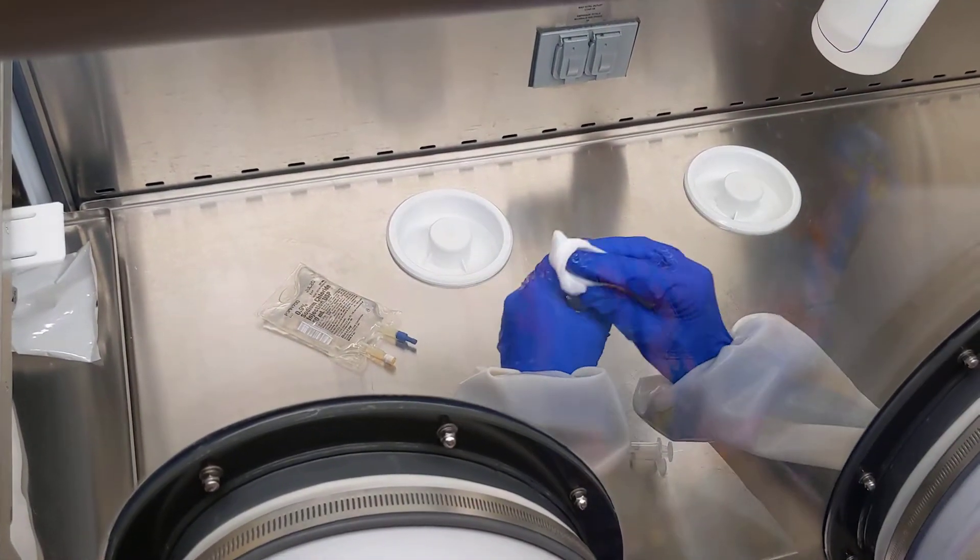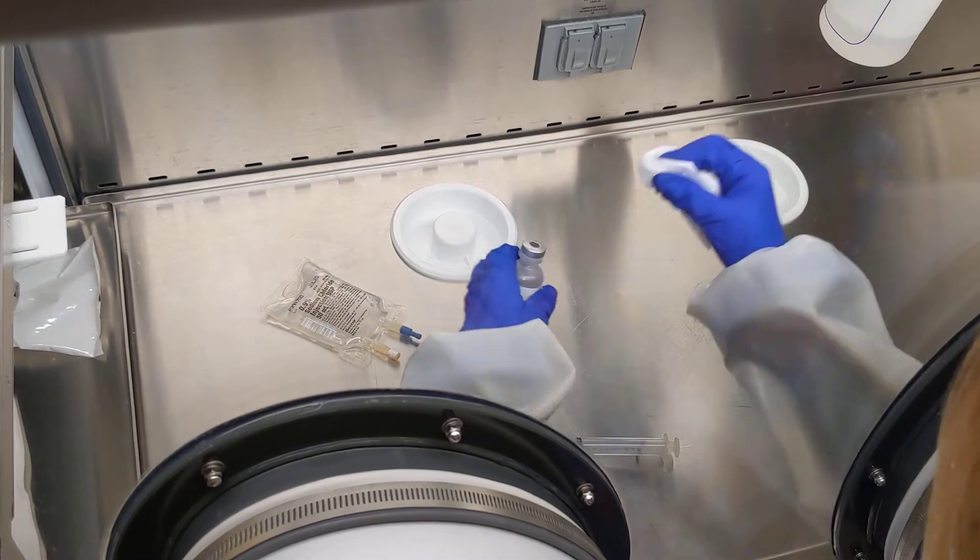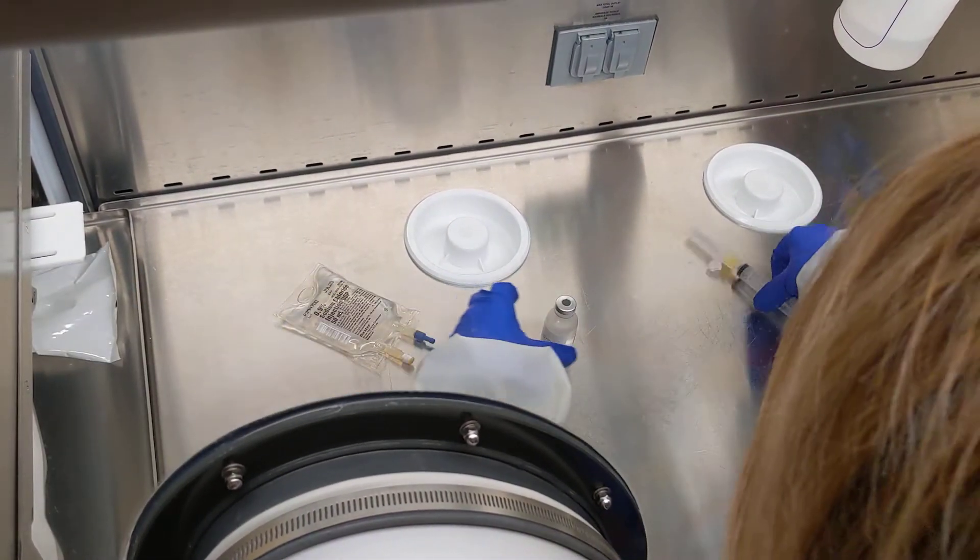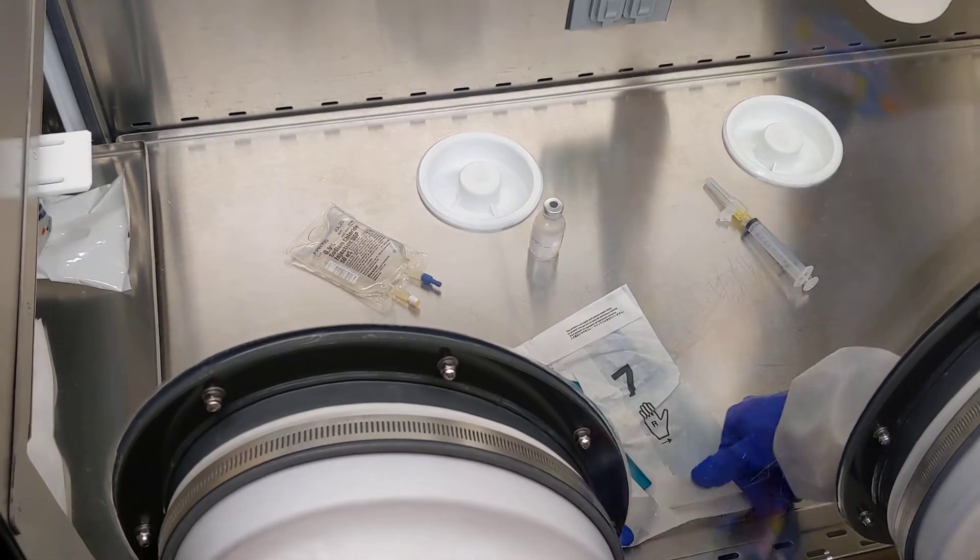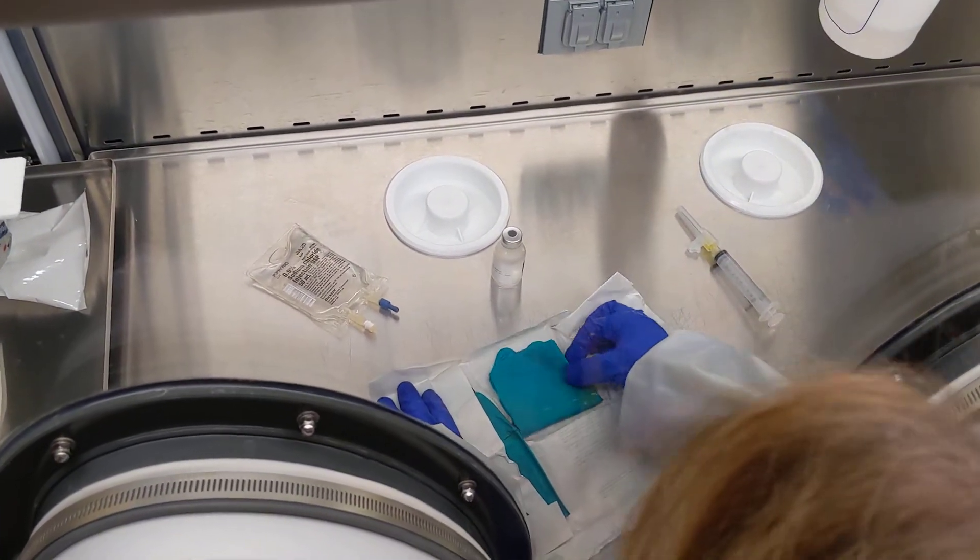These are alcohol wipes, really big ones. And then my third pair of gloves that go on are the actual sterile gloves.